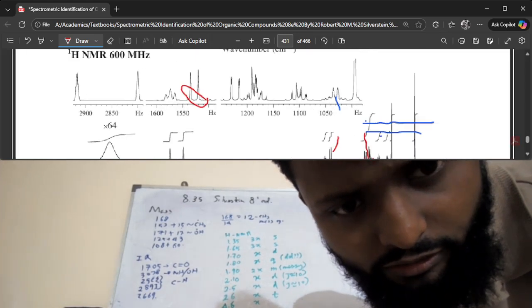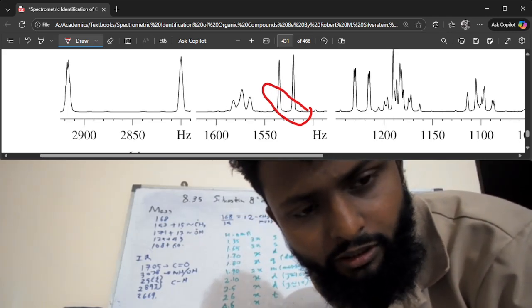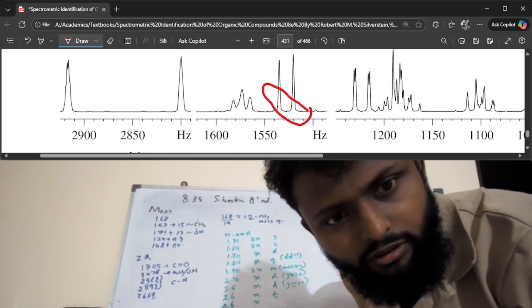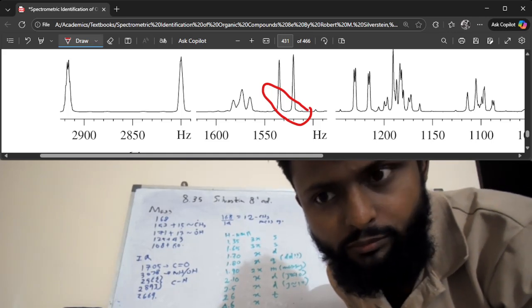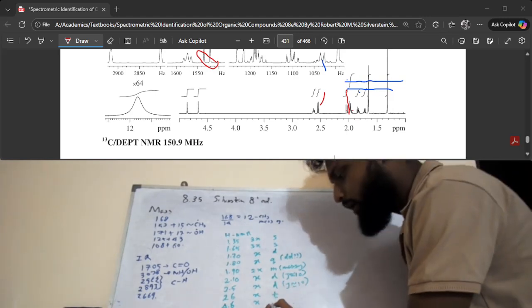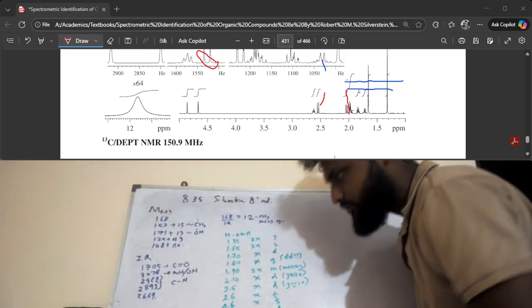like singlets. But if you really get close, you can see that one of them is a doublet, right? This might be a doublet, but this one is for sure a doublet, right? There's some anomaly in the shape of the peak here and there as well. Maybe there are two different peaks on top of each other. We just don't know at this point. So in our data sheet, what we are going to do is mark it as a doublet, and we're going to mark this as a singlet and this one as a doublet, right?